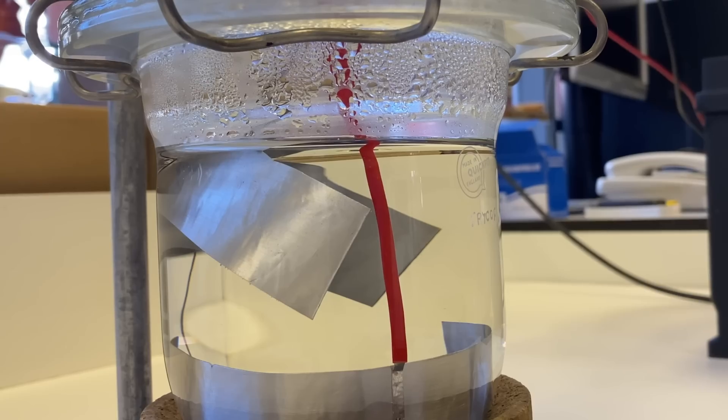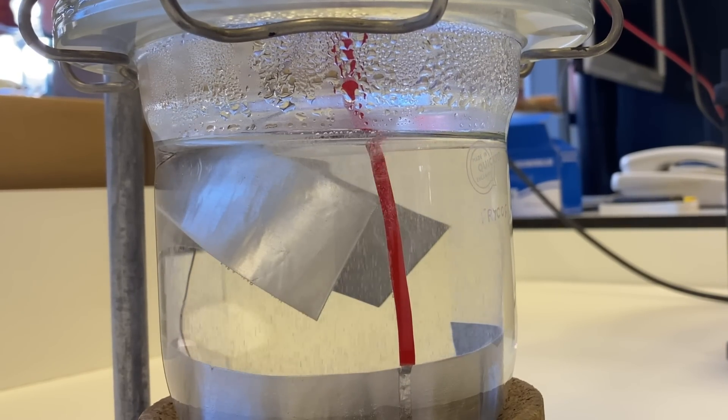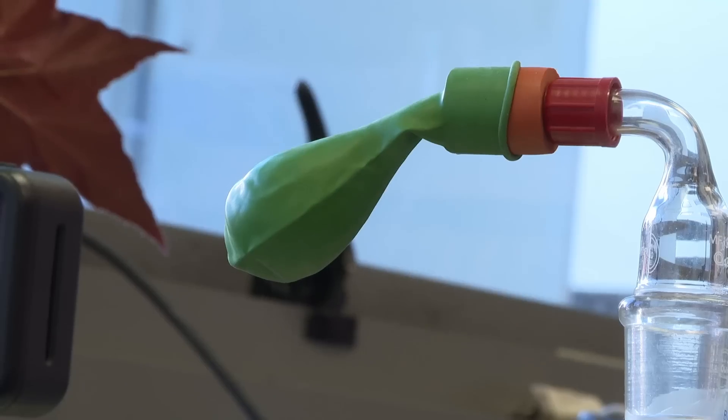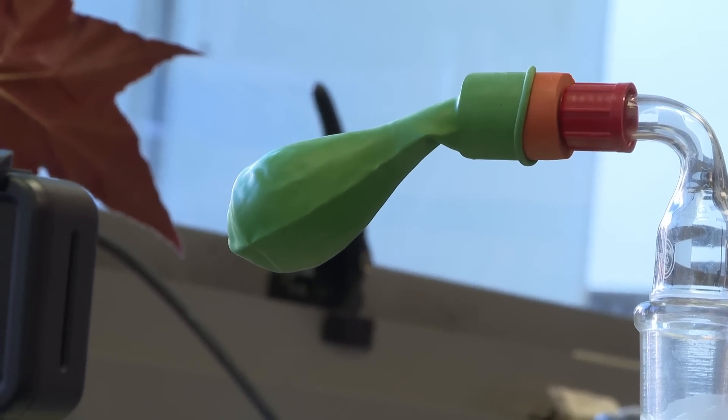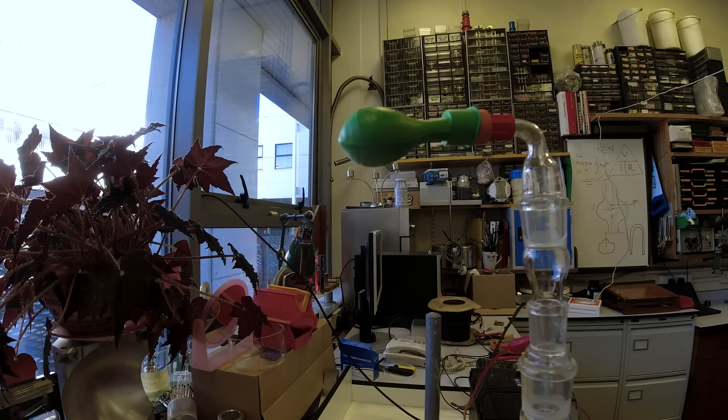Alright, I'm ready. It generates oxygen at one electrode, hydrogen at the other electrode. It bubbles up and into his green balloon. Initially, it seemed to inflate very slowly.